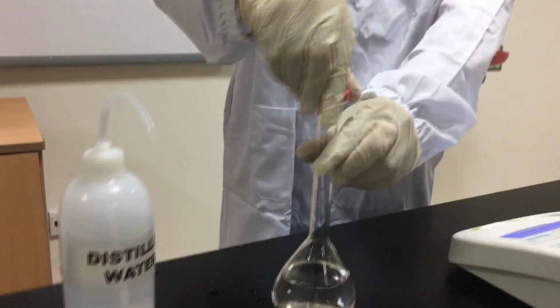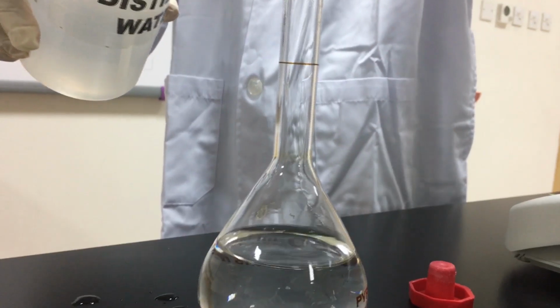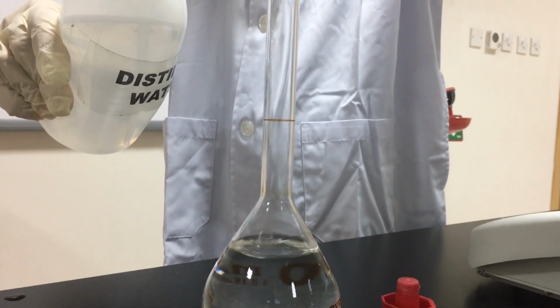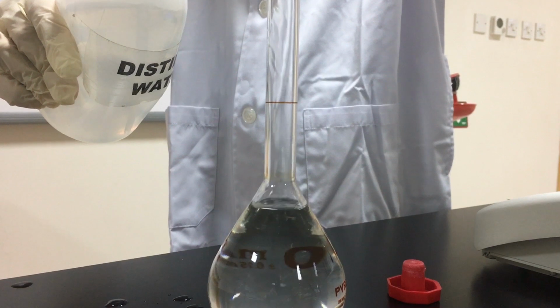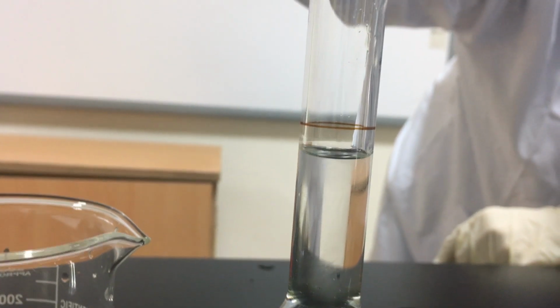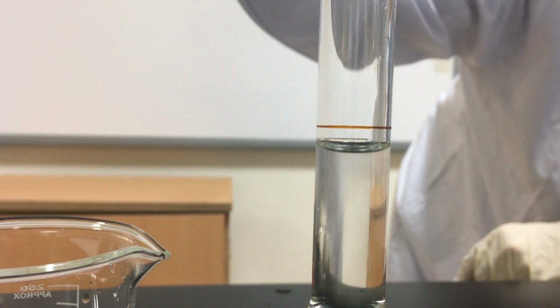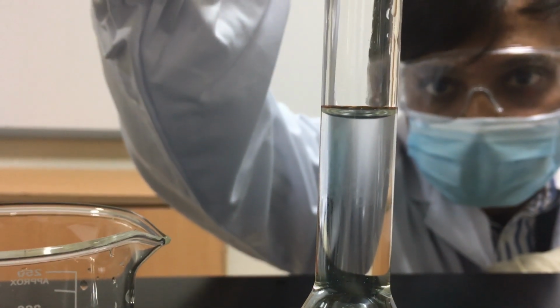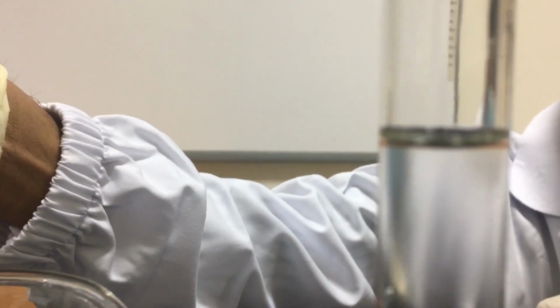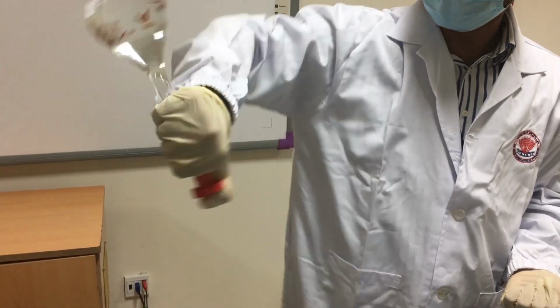When you are sure that the whole quantity of sugar is dissolved, add water to reach the neck of the volumetric flask. Use a medicine dropper to add water slowly until the bottom of the meniscus reaches the calibration mark. Pay attention, one drop will change the volume. Now, mix the solution transversely many times for homogenization.